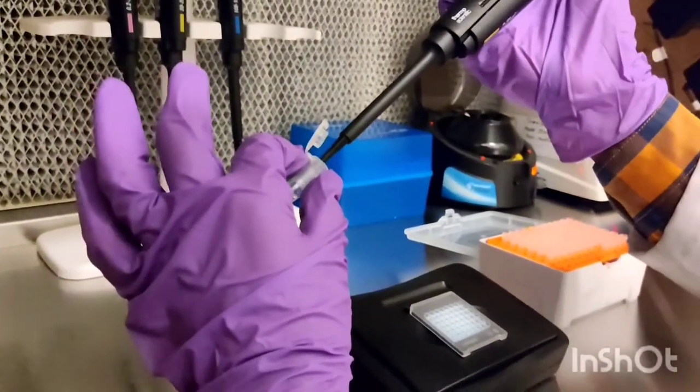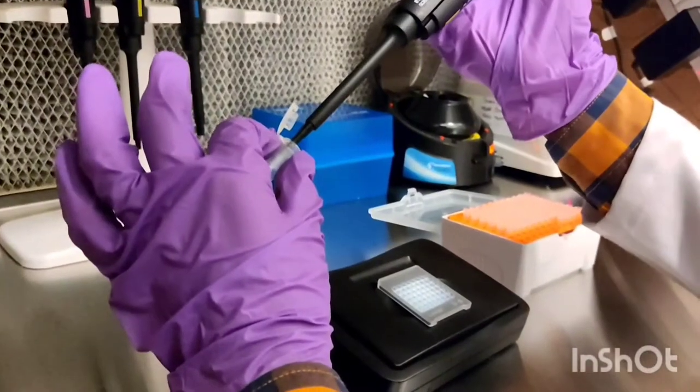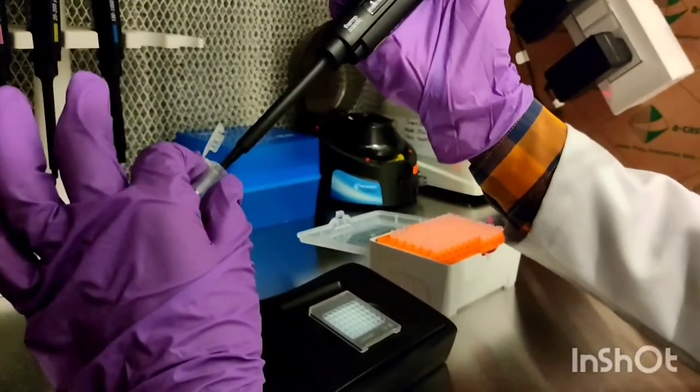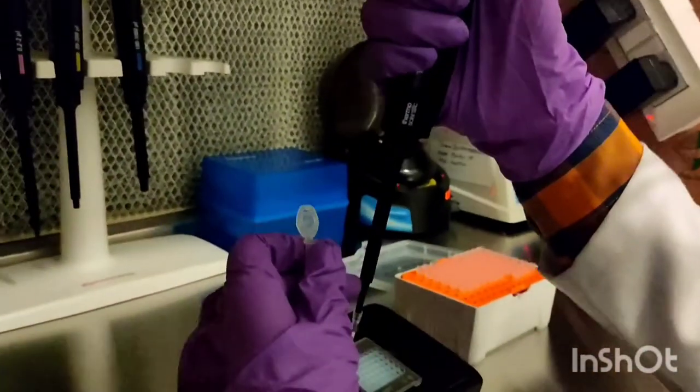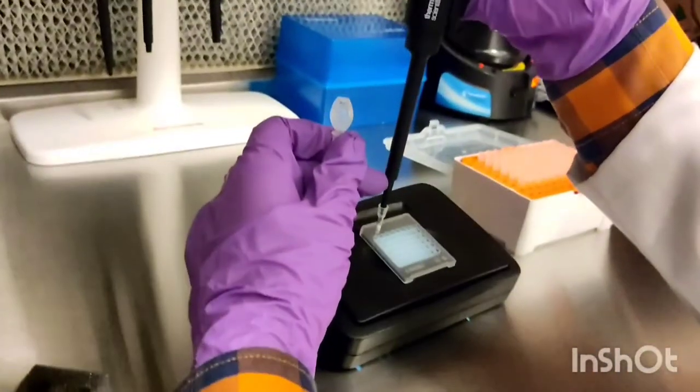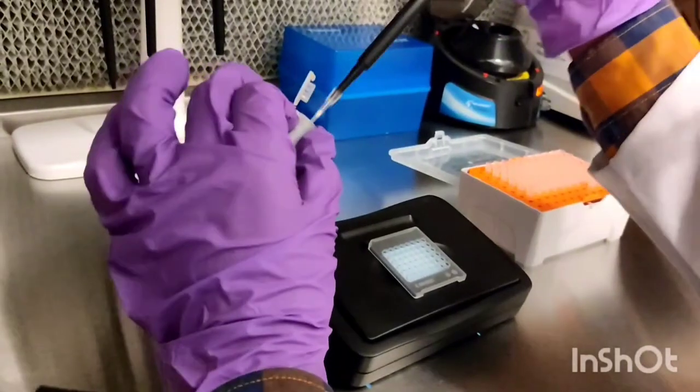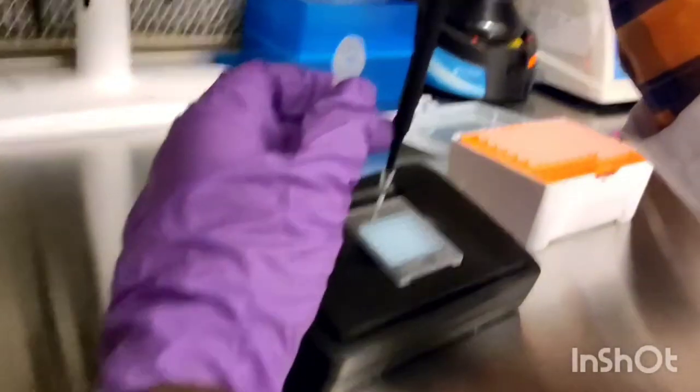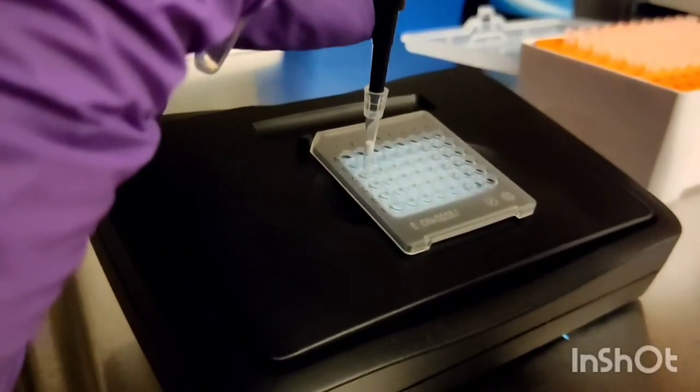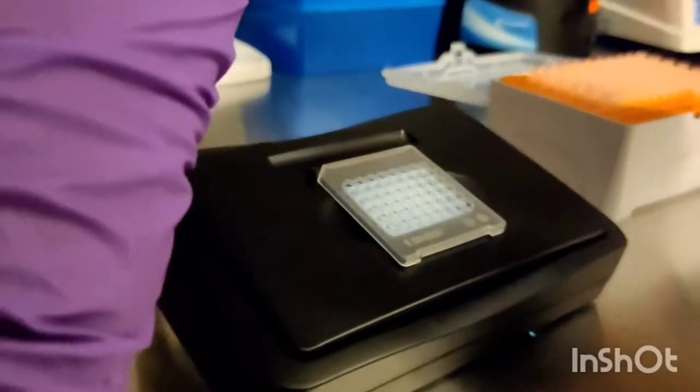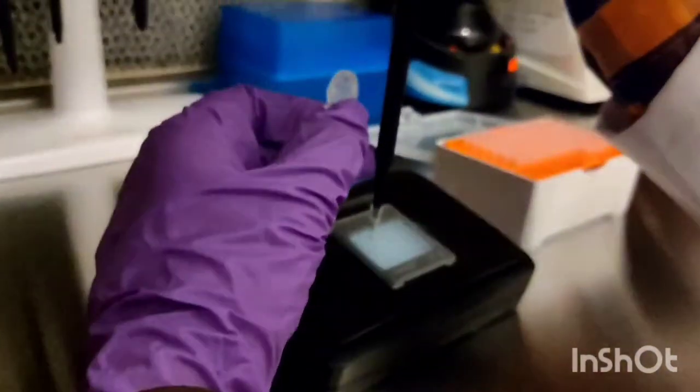Adding 10 microliters of prepared master mix in each well of the plate according to the reaction. Ensure that there is no bubble while loading the plate.